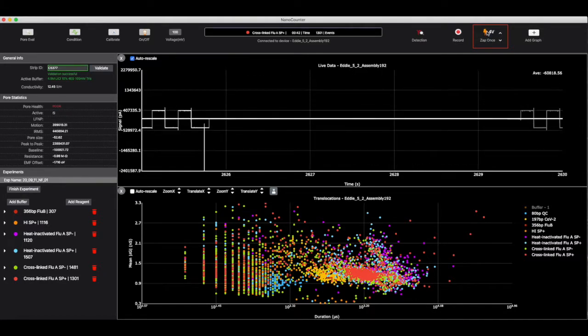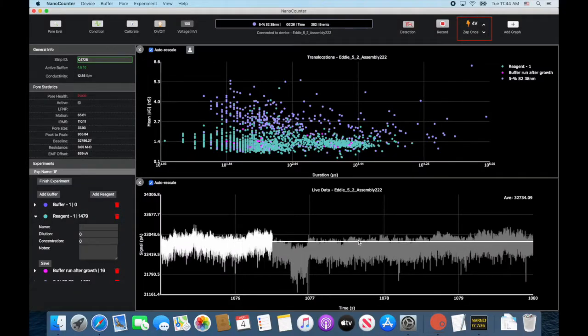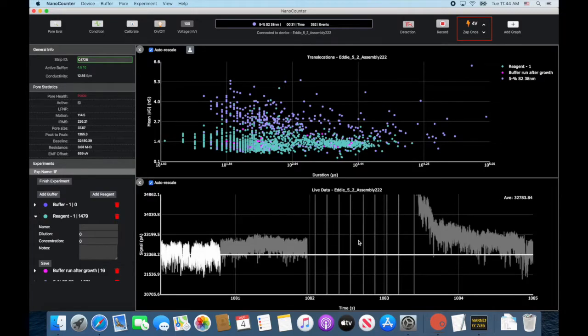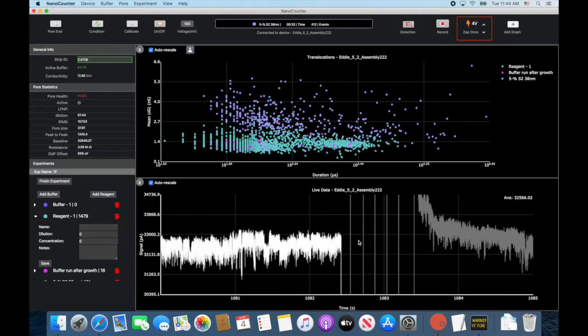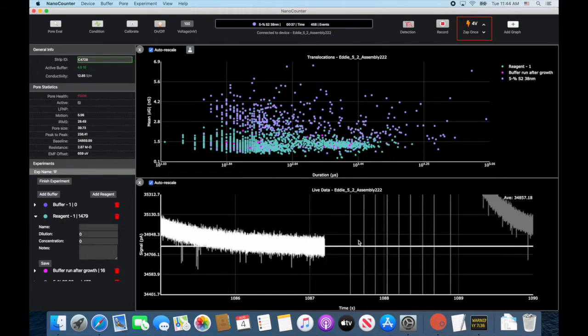To zap, click the lightning bolt icon in the top right corner of the NanoCounter app. Alternatively, Option Z or Alt Z work as keyboard shortcuts. Many clogs require multiple zaps to be cleared, so be persistent with zapping. It is the safest and easiest way to clear clogs.